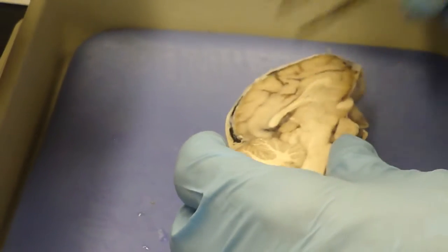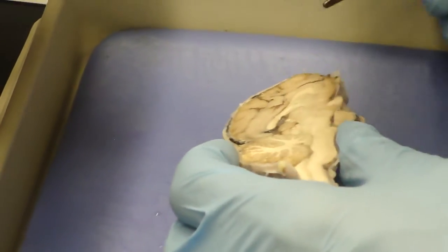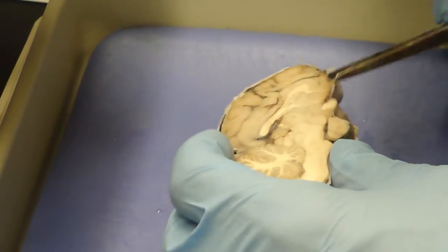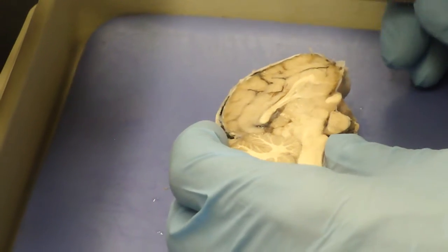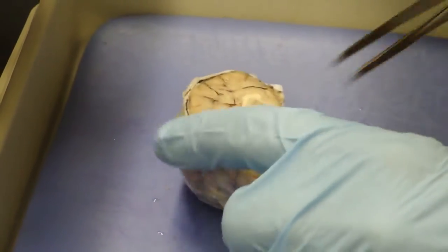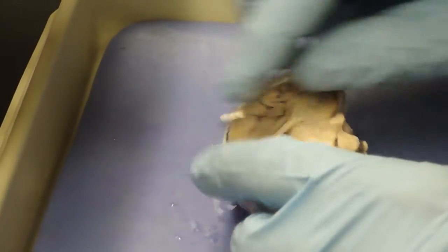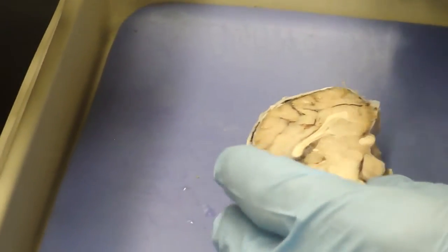You'll notice that cerebrum and cerebellum are the two big parts of the brain, fore and hindbrain, and the midbrain is small and tucked in between them. In humans, cerebral hemispheres are enlarged and the brain has a bend in it here, so this part is sort of tucked more deeply under the posterior part of the cerebral hemispheres. In elephants too, the brain is bent in a similar way.